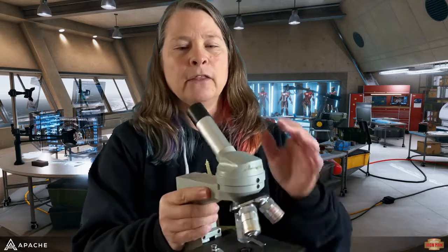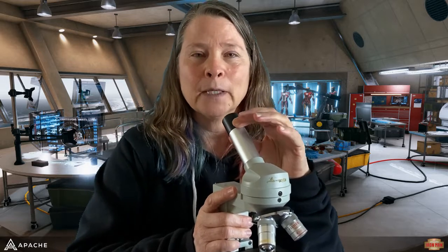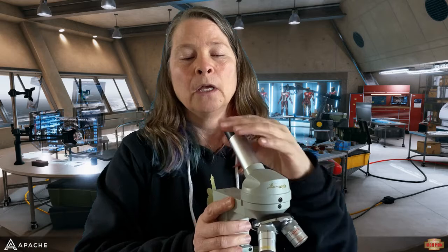The first part we're going to look at is on your sheet. It is part A. Part A is this right here. And this is called the eyepiece. Why is it called the eyepiece? I think you can figure that out. This is the part you're going to look through to try to see a specimen in the microscope on the stage. There are numbers on this.